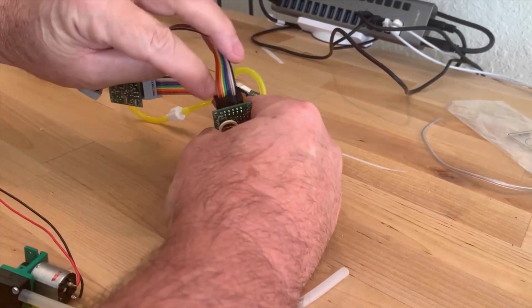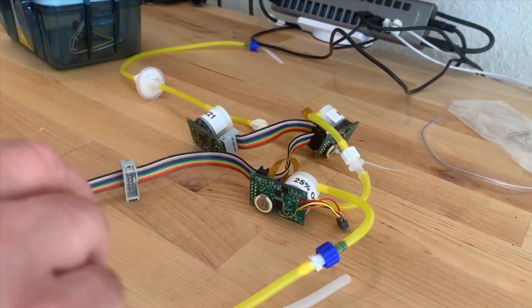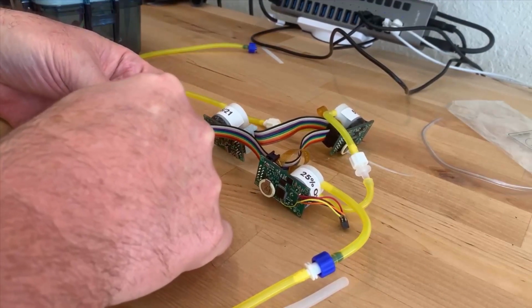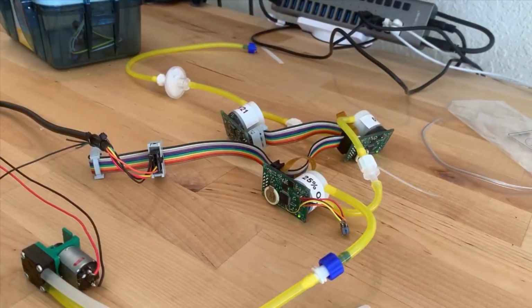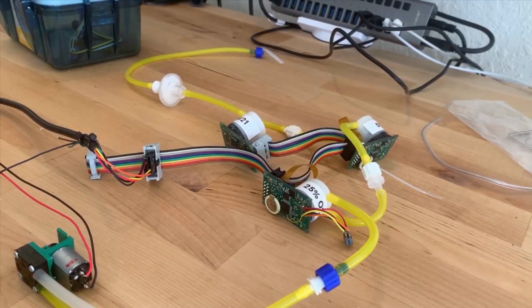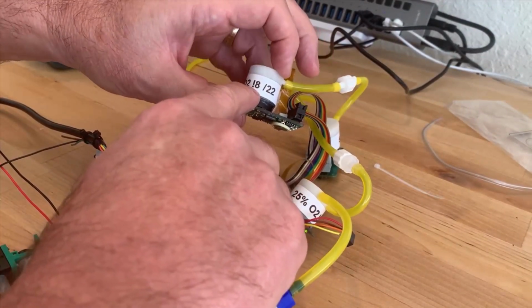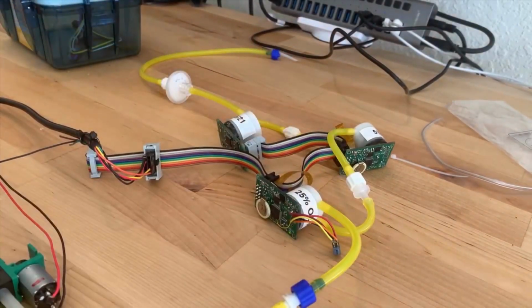The polarity of them is controlled. You see there's a notch on the end of this, and so the notches are always on the outboard side. The same thing happens when we actually make the electrical connection to the computer, where we're going to get power, and we'll be talking to GasLab. It has the same kind of keying, and it goes in here. And now we have all three of these sensors online. I have gone through already, and for example, you can see on these sensors here that I've marked what they are and what addresses we're using. This would be the exclamation or the terminal mode, and this would be a Modbus mode address, so that you can support two different kinds of communication simultaneously.